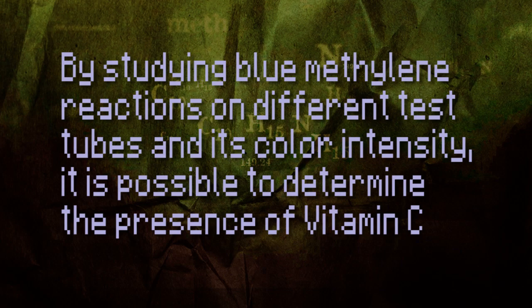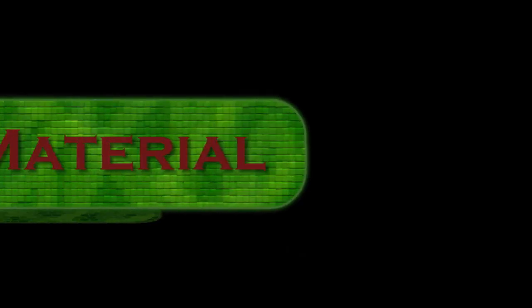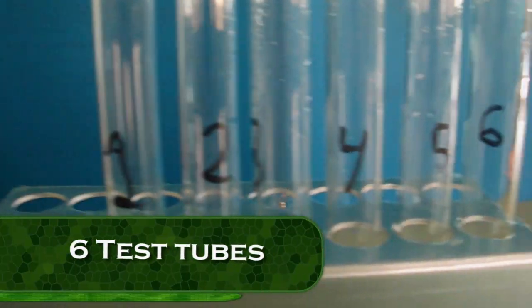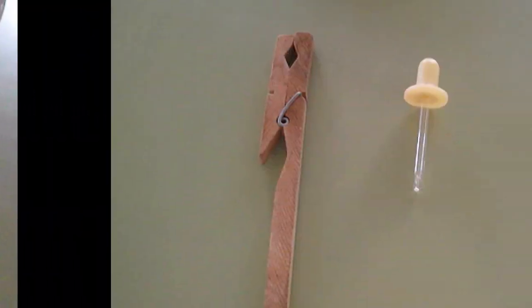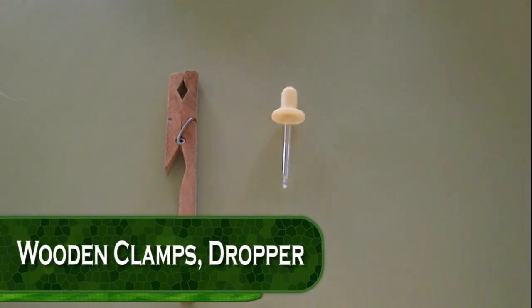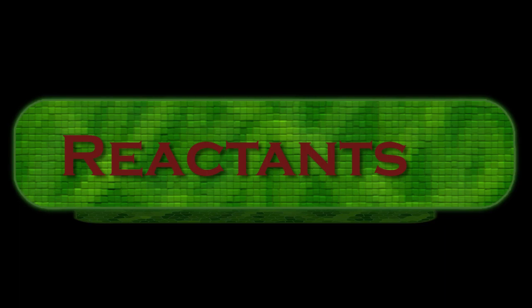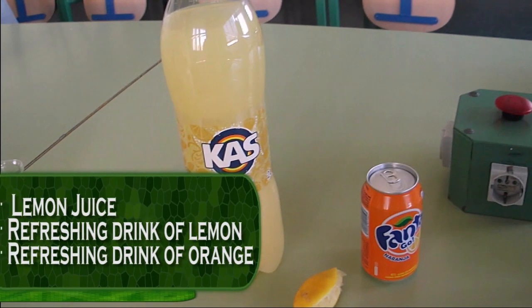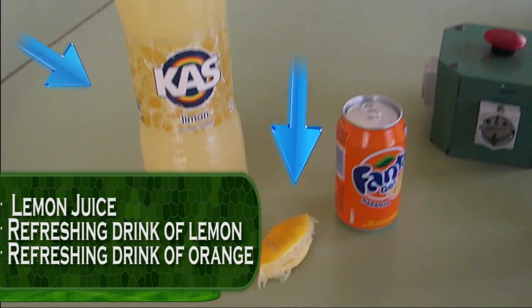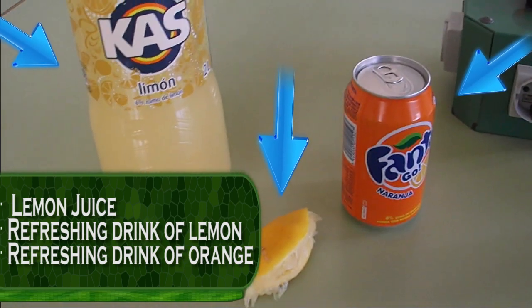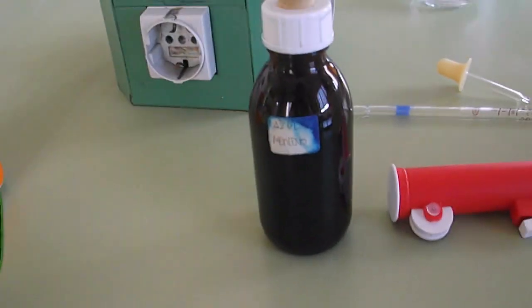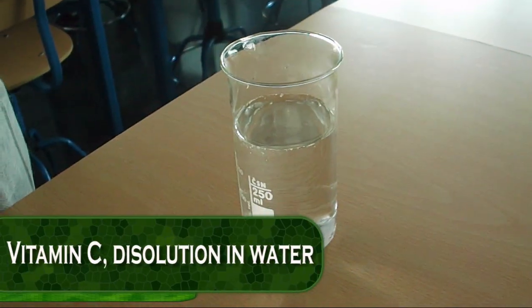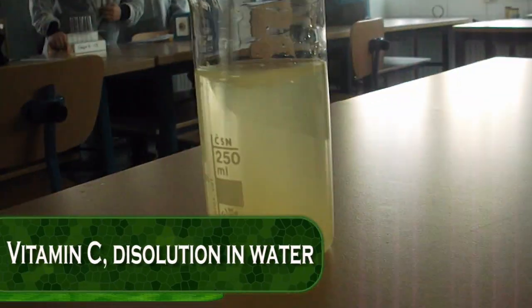Materials: six test tubes, alcohol burner, wooden clamps, dropper, reactants including lemon juice, refreshing drink of lemon, refreshing drink of orange, blue methylene 1%, and vitamin C dissolution in water.